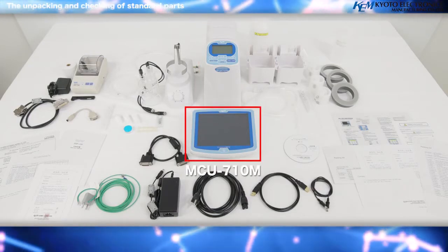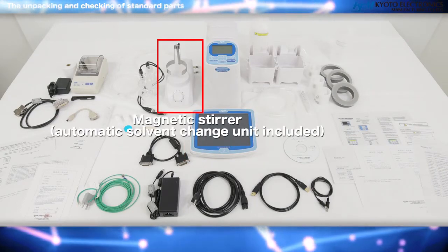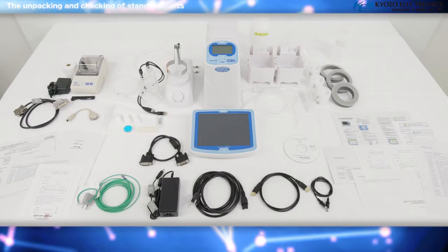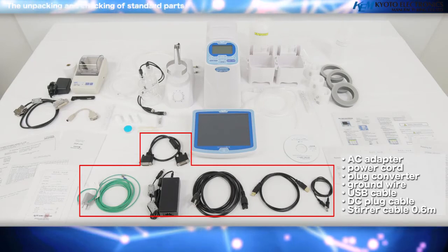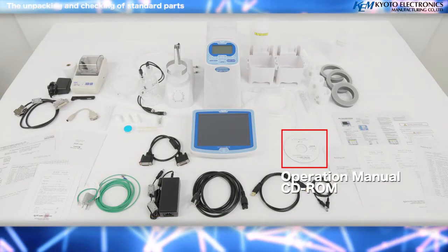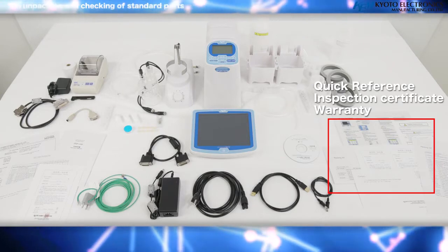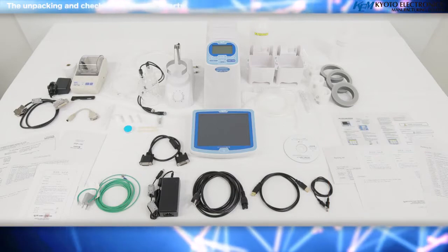MCU 710M, Magnetic Stirrer, Automatic Solvent Change Unit, Titration Cell Unit, AC Adapter, Power cord, USB cable, DC plug cable, Operational Manual, CD-ROM, MKC 710 Quick Reference, Inspection Certificate, Warranty, Contact, Packing List.